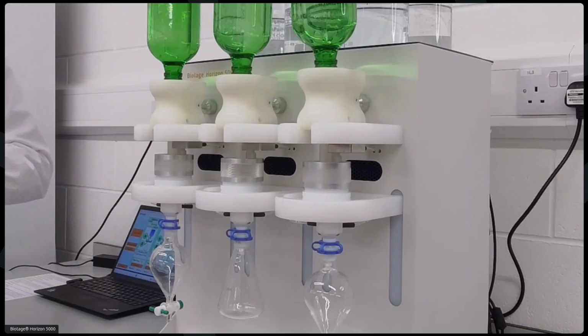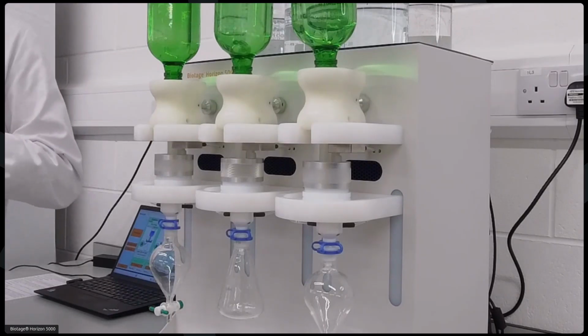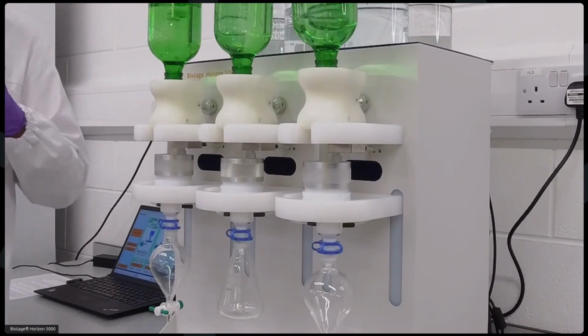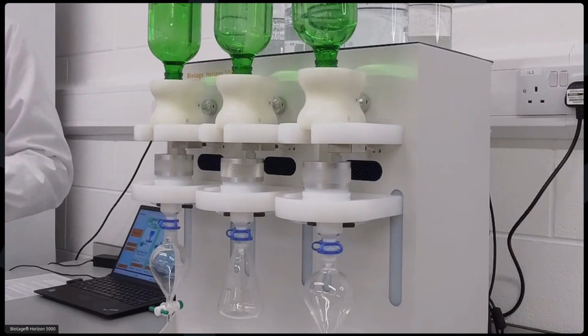I'm just going to take a question here whilst we are waiting, Wayne, if that's okay. There is a question on nitrogen use. How much nitrogen does the system use? So the system doesn't actually require any nitrogen. The system can use the vacuum pumps to dry the disk. But if you do want to use nitrogen, then that is optional, and you can plug it in at the back. But as I said, that's not a requirement at all for the system, and you can dry the SPE disk using just air and the vacuum pumps pulling air. Fantastic, thank you.